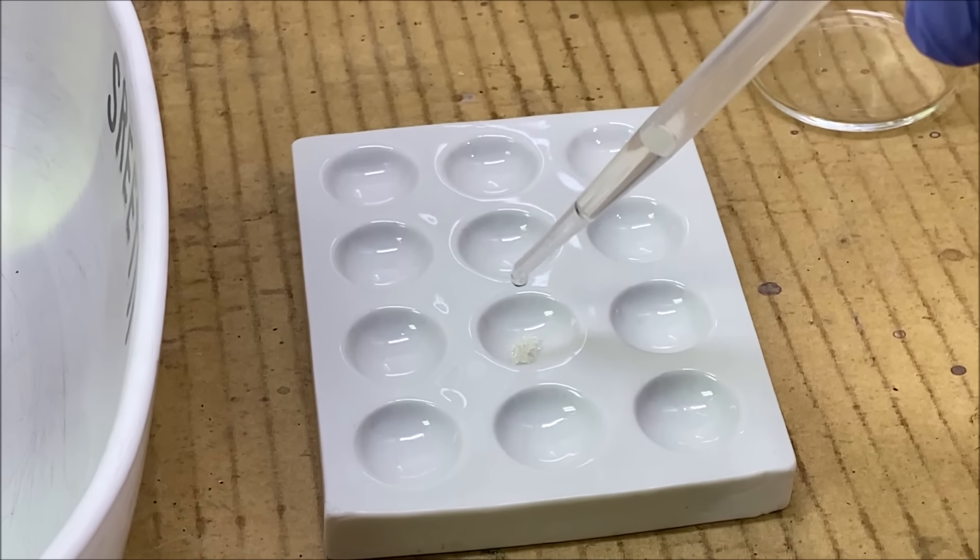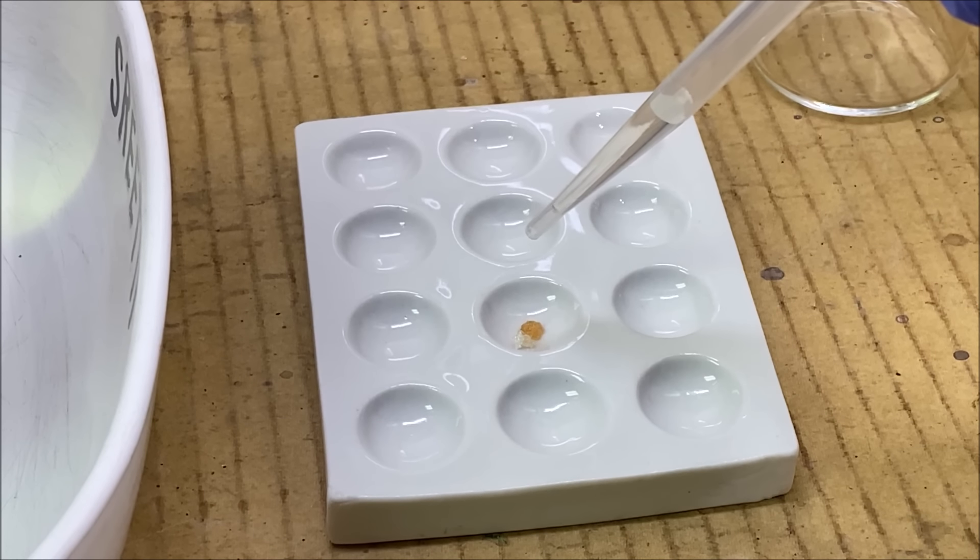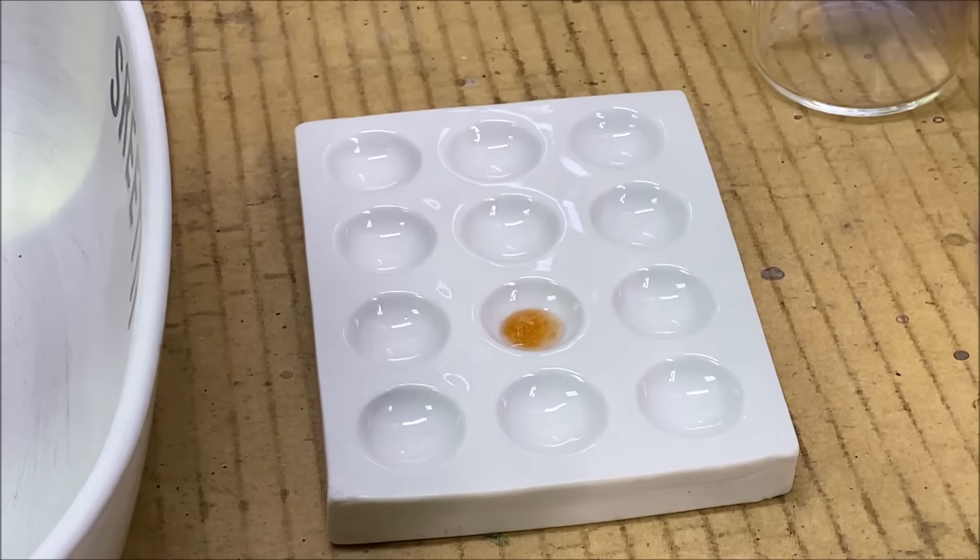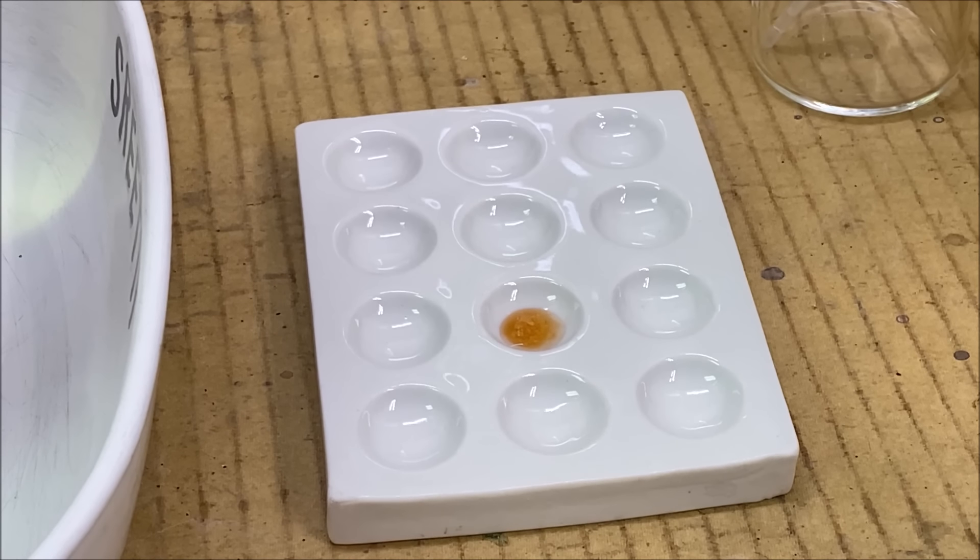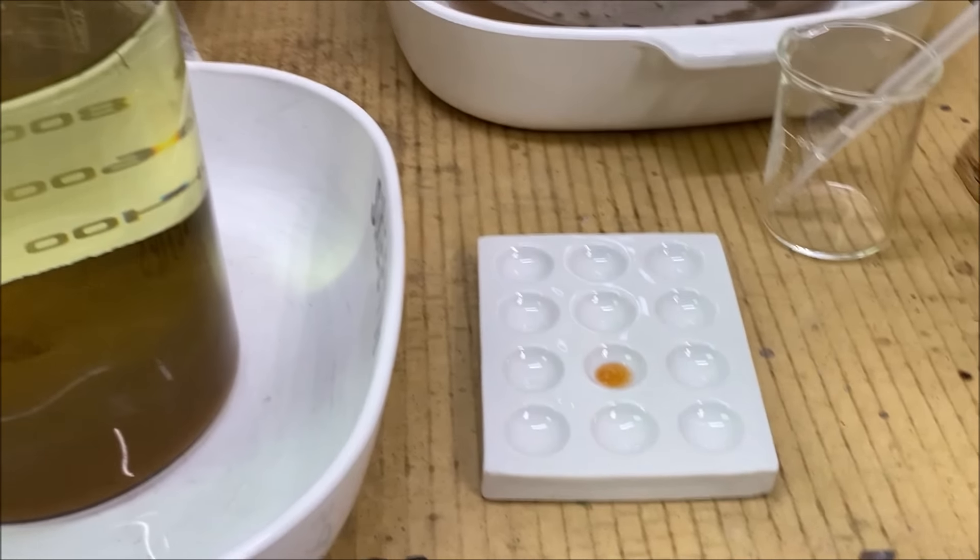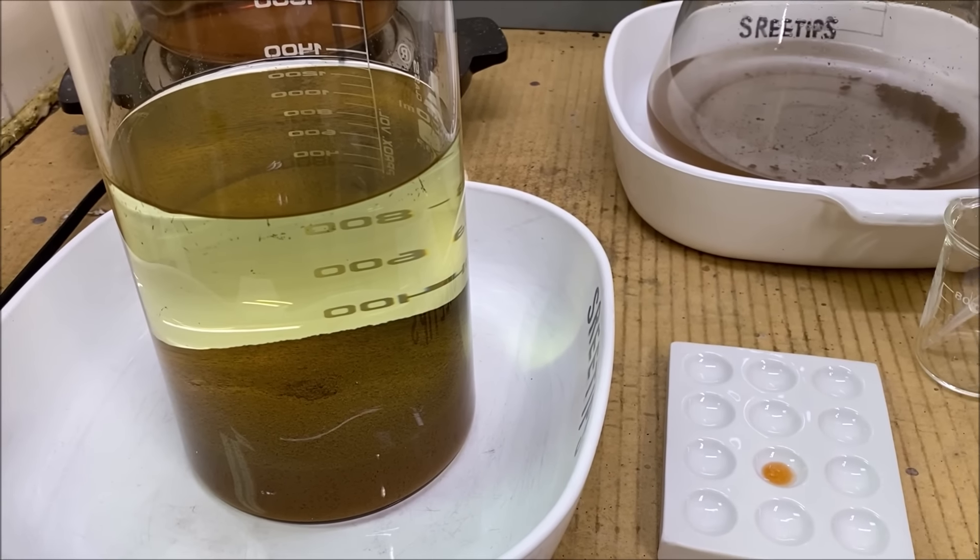Let's see what we can get here. Oh yeah, look at that. See how that turns red? That means we've got iron in our solution on top of this gold.